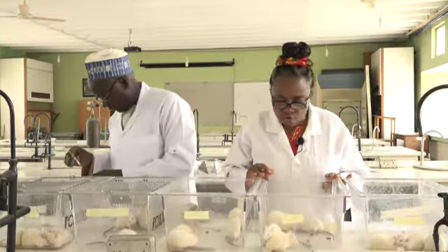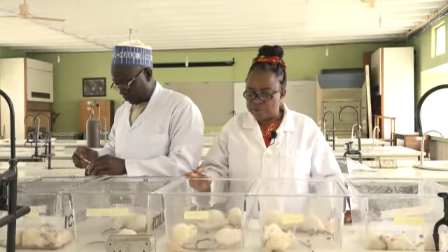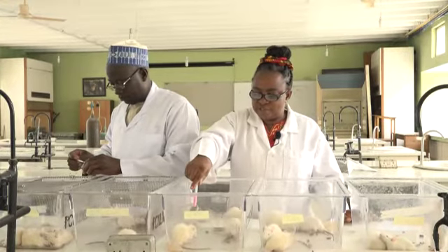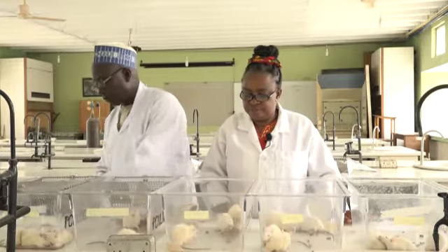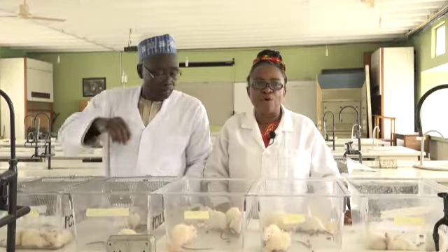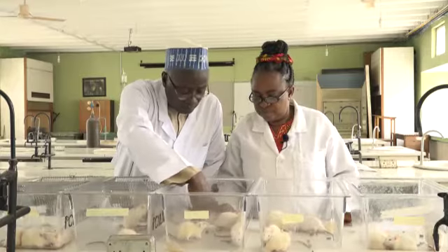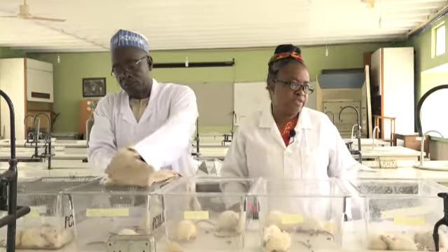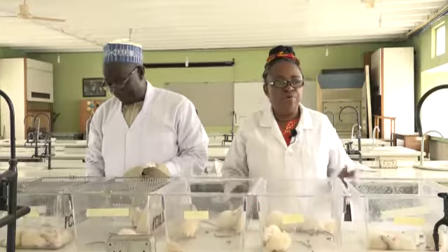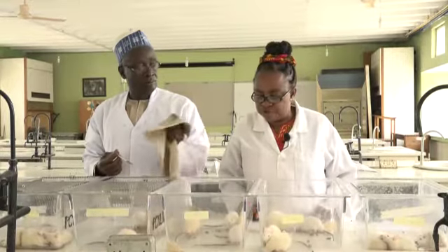These animals were not poisoned. These ones are being poisoned. Watch this rat. It's also beginning to exhibit signs of toxicity. Death from organophosphate can be painful. Those who have survived have always expressed regret. They didn't know that all those abdominal constrictions were going to be so hurtful.